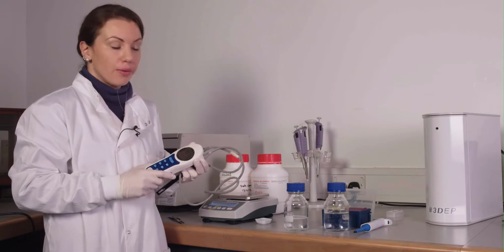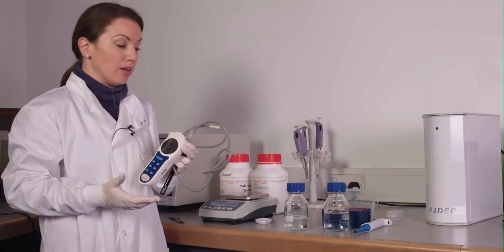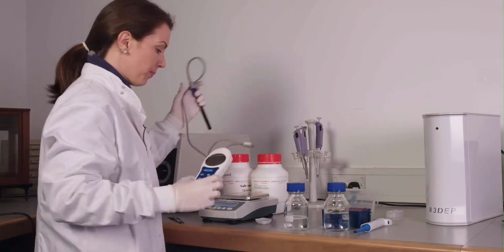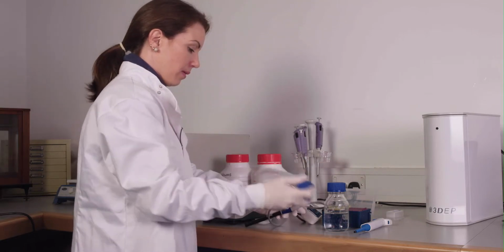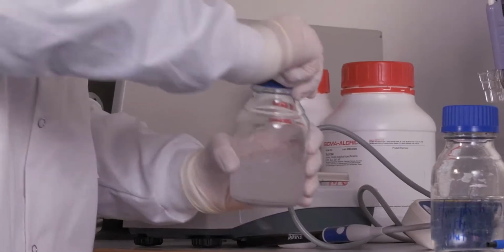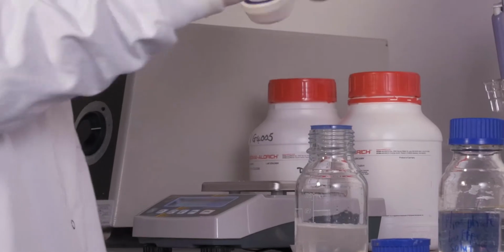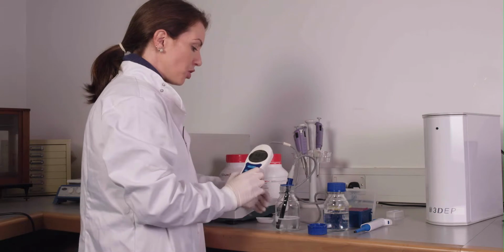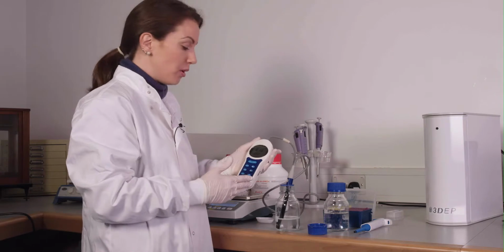Again, this is dependent on your cell type. A good starting point, if you've never done a cell type before, is 10 millisiemens per meter. Most conductivity meters measure in microsiemens per centimeter, so this will be 100 microsiemens per centimeter on the meters. This mixture will measure fairly low, somewhere between 5 to 10 microsiemens per centimeter.